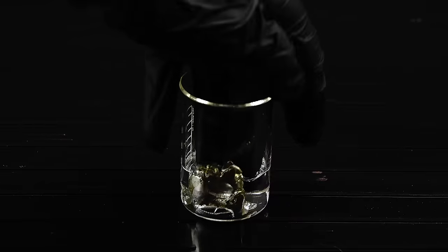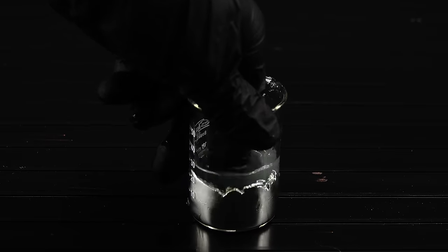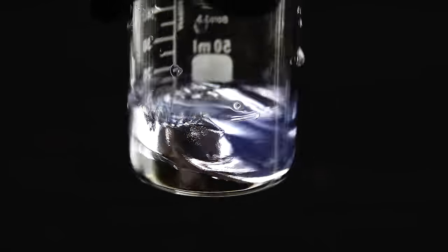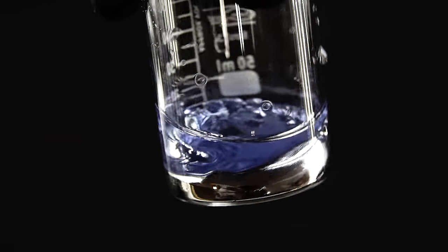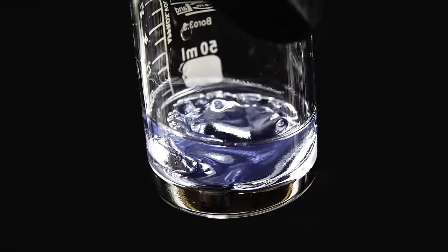Almost immediately upon adding the amalgam to it, pretty much all of its ugly crust disappeared, and the solution took on a light blue color which confirms my theory about increased copper reactivity, and makes the contents of this beaker look like some futuristic ghost liquid metal technology.